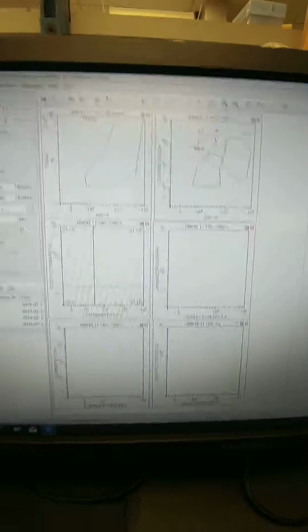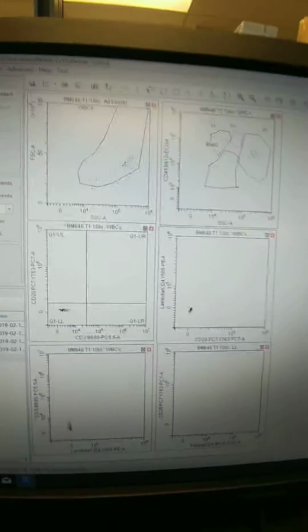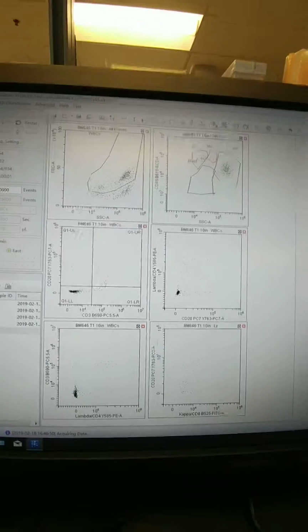And so now regardless of how the data looks here, I'm just going to let it run and collect some and then hit stop. I'm not going to mess with the comps any. I'm not going to adjust gains any while it runs. Okay.